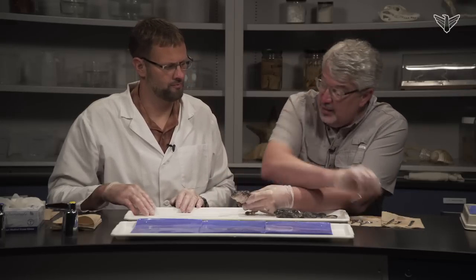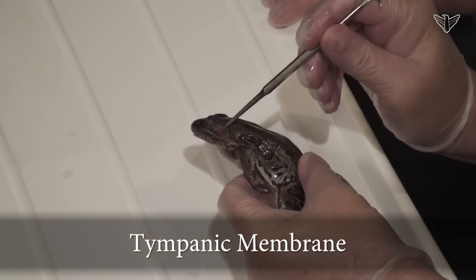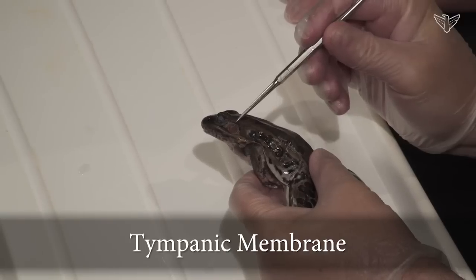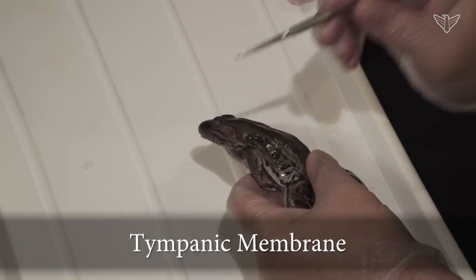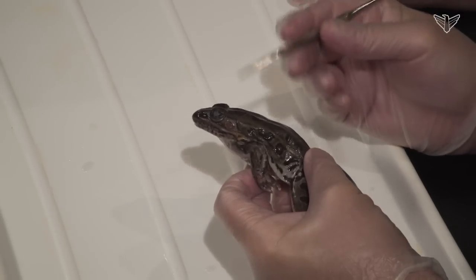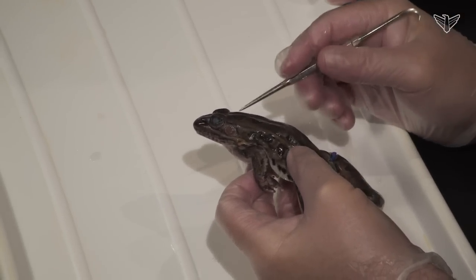You can see there's a tympanic membrane right behind the eye, and we have a tympanic membrane too — our eardrum — as the name tympanic implies. This vibrates in response to sound waves, and so these animals are not only very good at picking up sounds, they produce sounds — as we know — for mating calls and territorial advertisement.